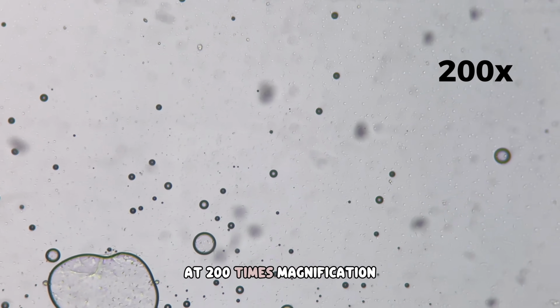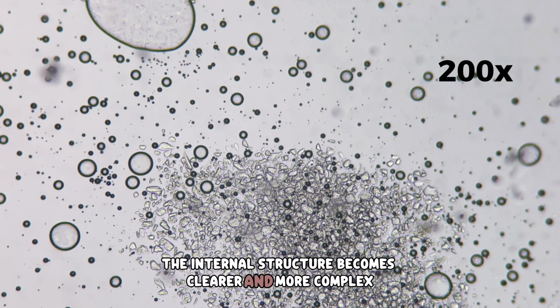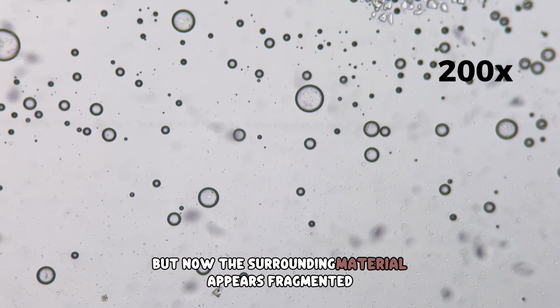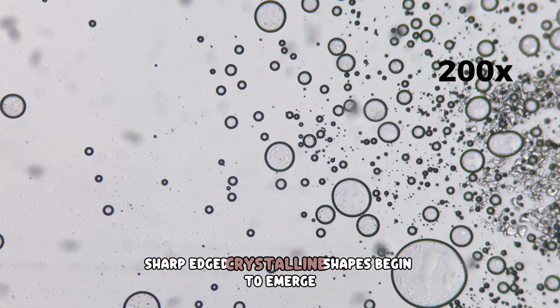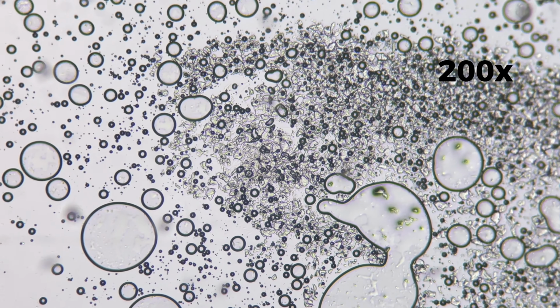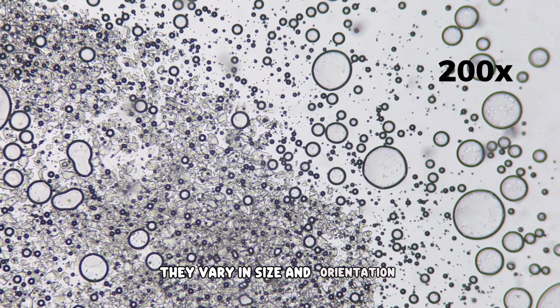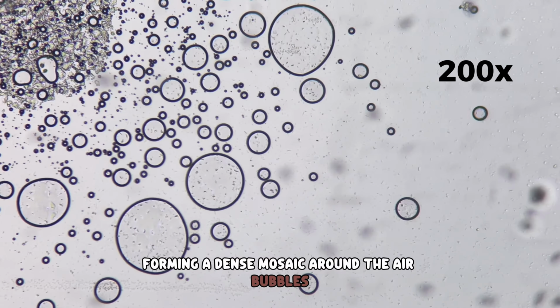At 200 times magnification, the internal structure becomes clearer and more complex. The circular air pockets remain visible, but now the surrounding material appears fragmented. Sharp-edged crystalline shapes begin to emerge within the darker clusters. These irregular, angular fragments are sugar crystals. They vary in size and orientation, forming a dense mosaic around the air bubbles.